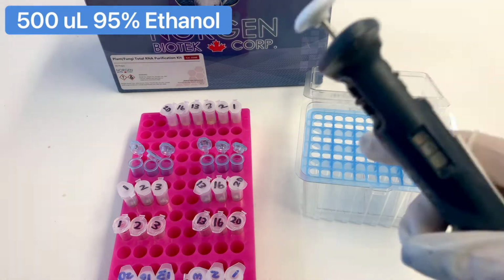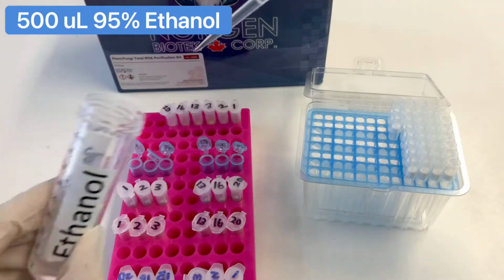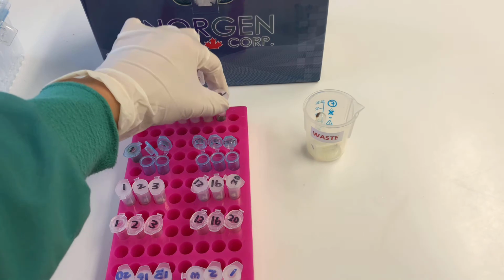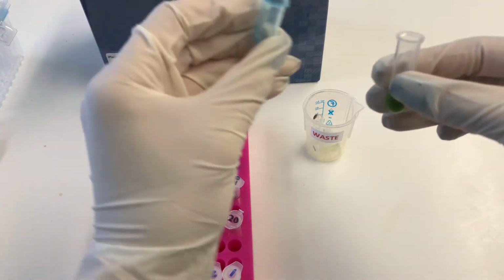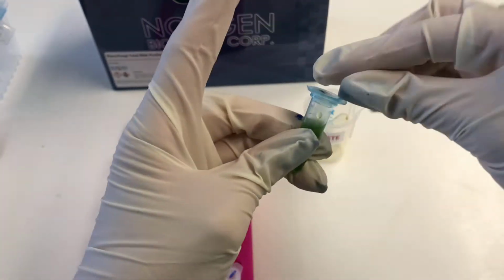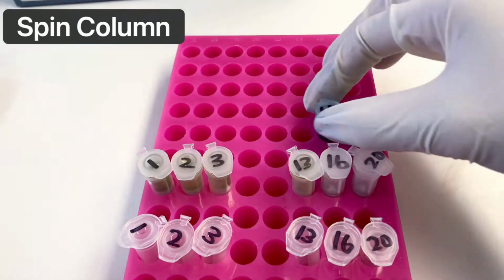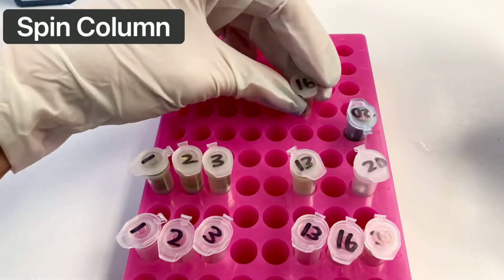Next, we are going to add 500 microliters of ethanol to some empty 1.5 ml tubes. Then we will take our lysate and add it to the ethanol. You may discard the filter column. Gently invert to mix. This is going to precipitate our RNA, which is going to make the RNA into a more solid substance. Now we are going to take that solution and put it in a spin column.